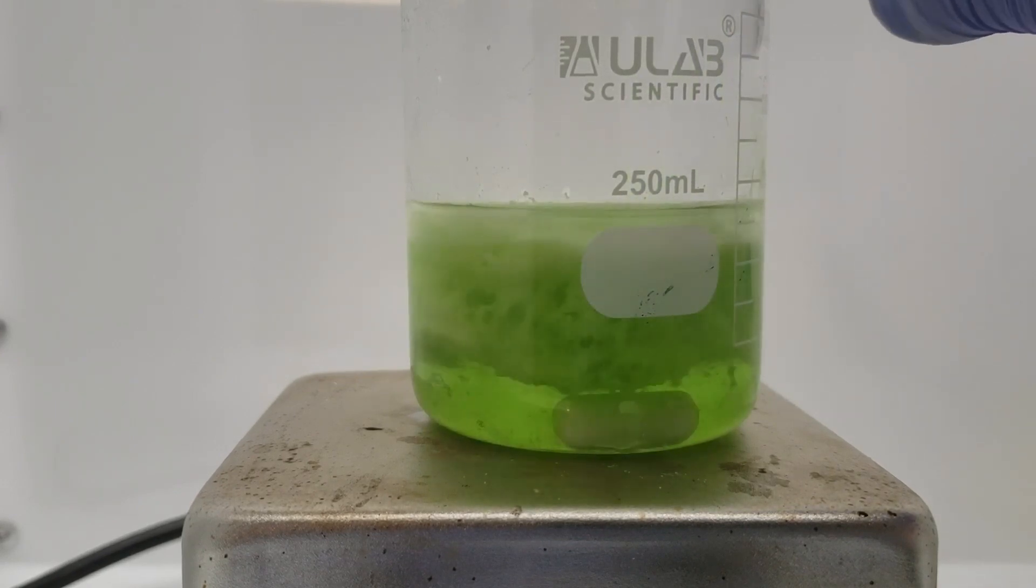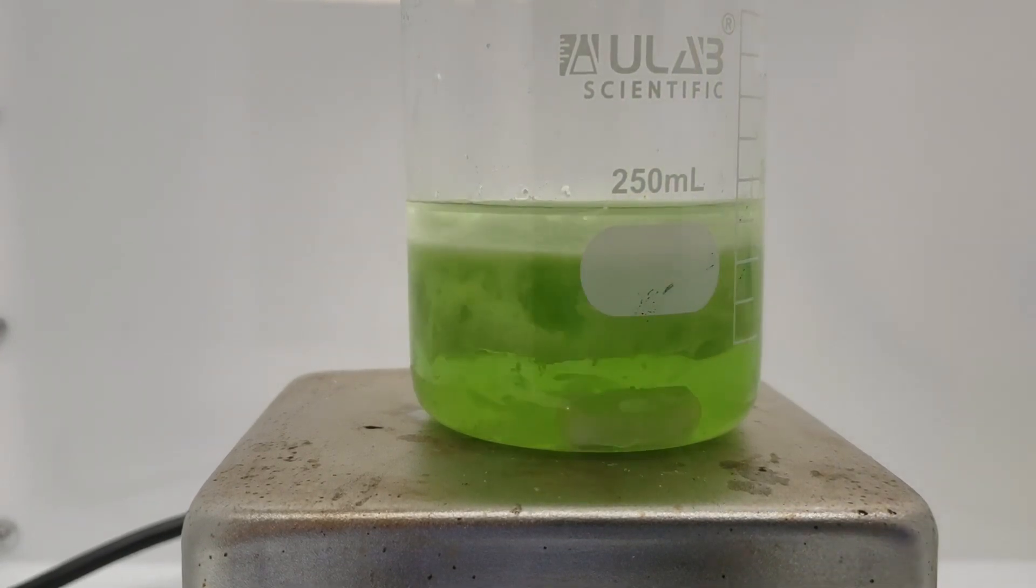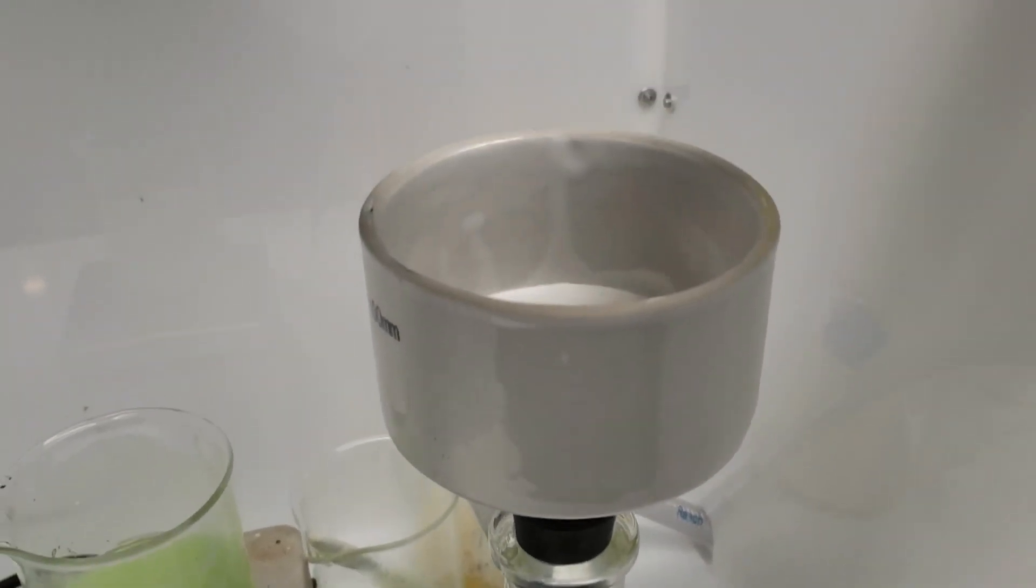After sitting for a minute with occasional stirring, the product is fully precipitated. The slurry is then transferred to a Buchner funnel.